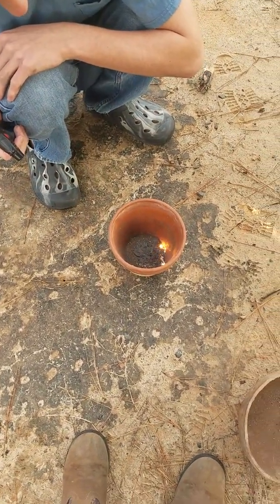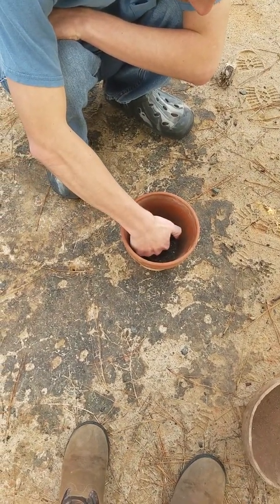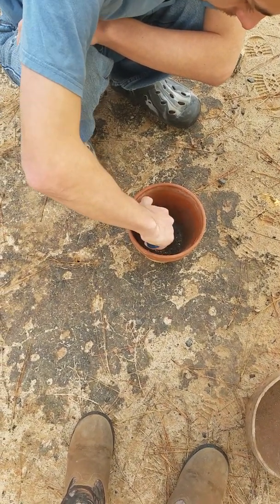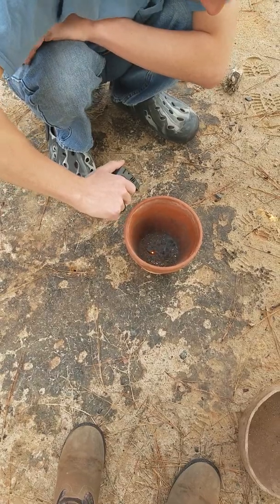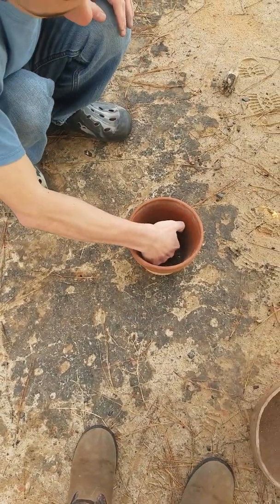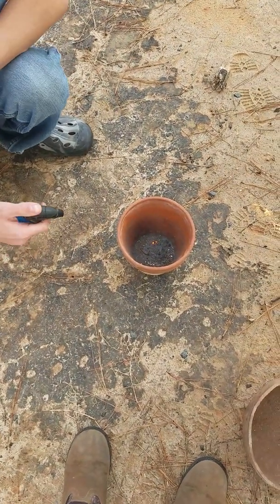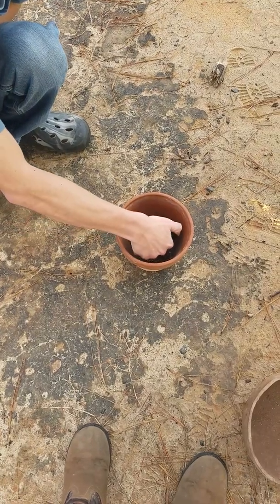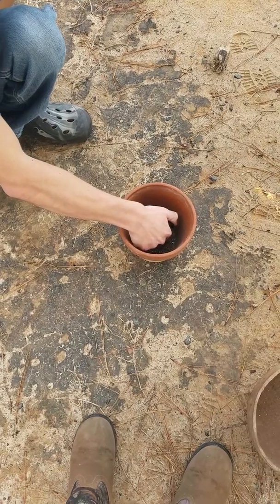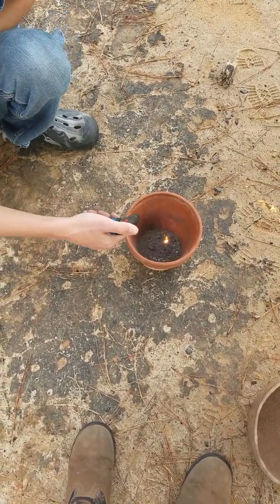Can you not melt the iron beads together? No, there's just not very much iron with this concentration — it's less than a gram. That smoke is also very toxic, don't breathe it. I'm probably going to get very congested later because I breathed in a little bit. If you can smell it, you should probably move.